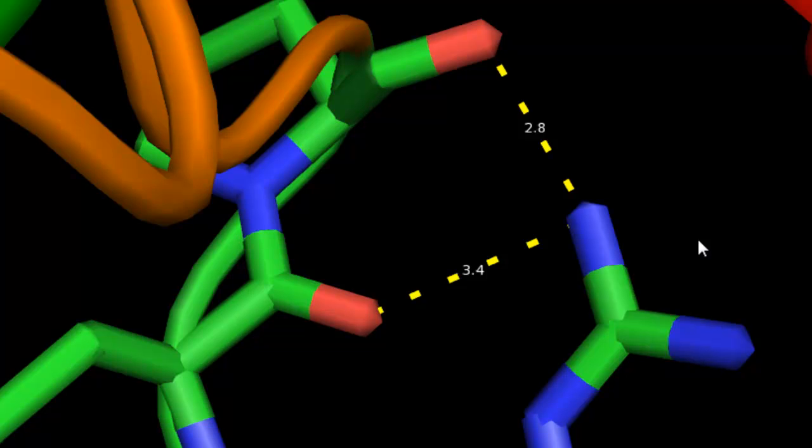Now, why do we care about these angstroms and measurements? The reason I selected these residues in the first place is that these oxygens are dipoles, so they have a negative charge. However, this side chain here, the arginine, is a nitrogen, and this is most likely an NH3, since this is a basic amino acid residue, which has a very high pKa value. So at physiological pH, this is most likely charged. It's a proton acceptor.